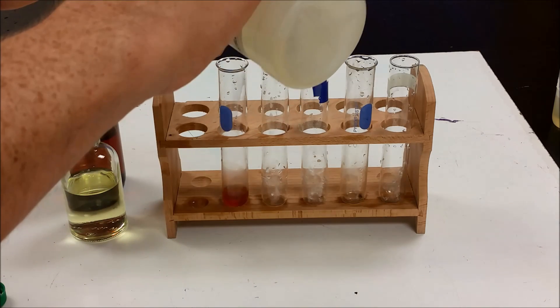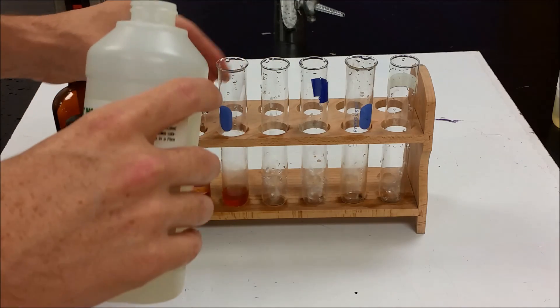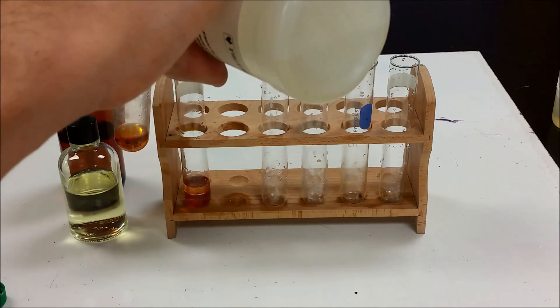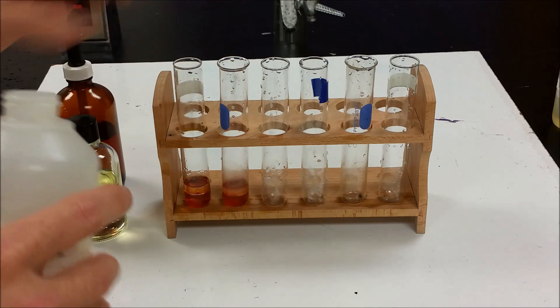But first, we're going to go ahead and put a little bit of hexane, heptane, sorry. And that's going to help us kind of see who wins these battles.